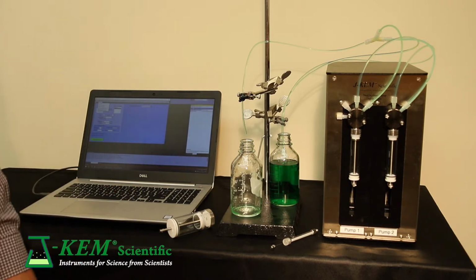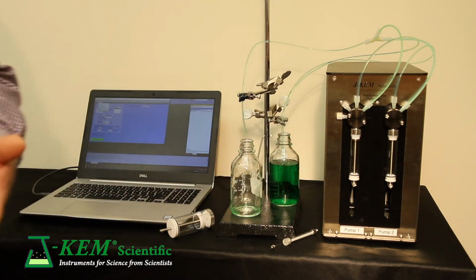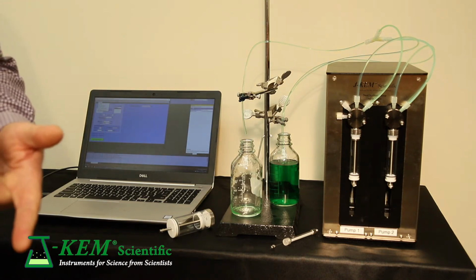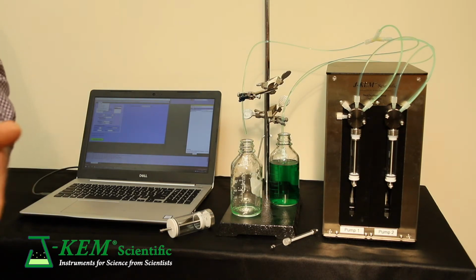What's unique about the pump itself is it's high resolution. So from the top of this syringe to the bottom of that syringe, there are over 3 million steps, which give it extraordinary precision. All of our syringes of any size have microliter accuracies in their dispenses and their withdrawals.